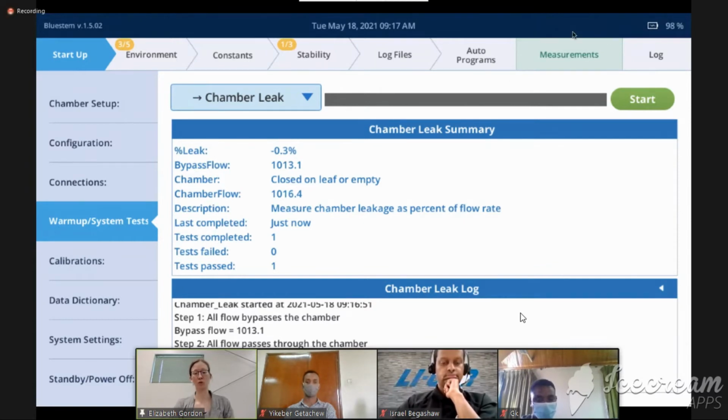That's not a problem at all. But if my chamber was open instead of closed, then I would have potentially a very large leak. And then this test would stop, actually. It would say, no, I can't do that. The chamber is open.